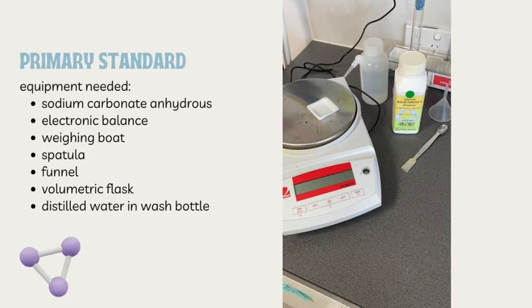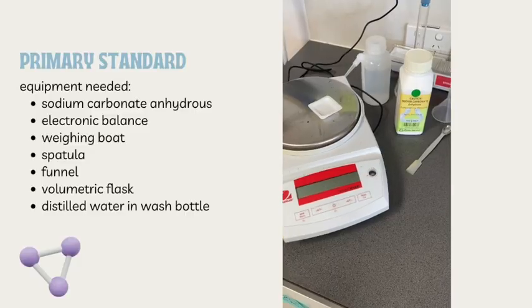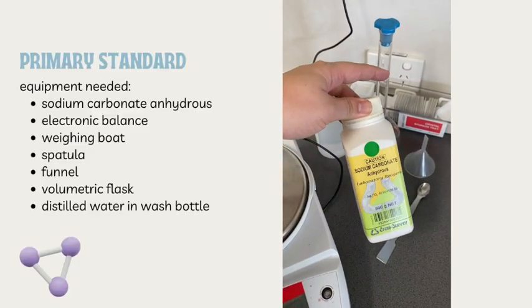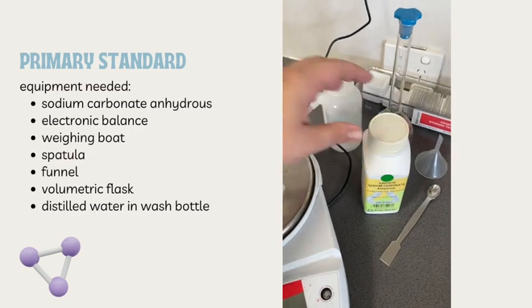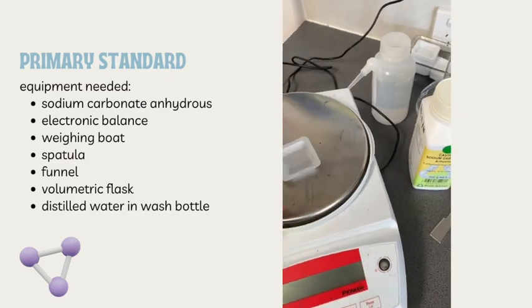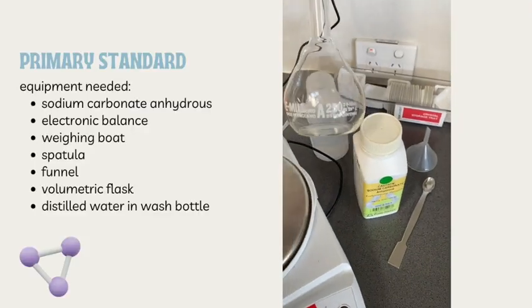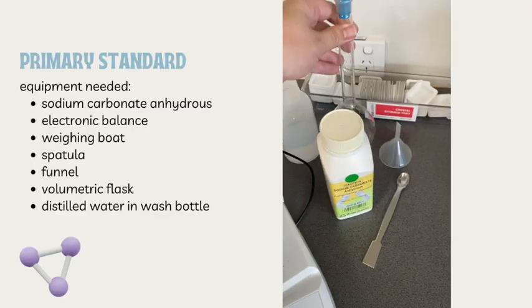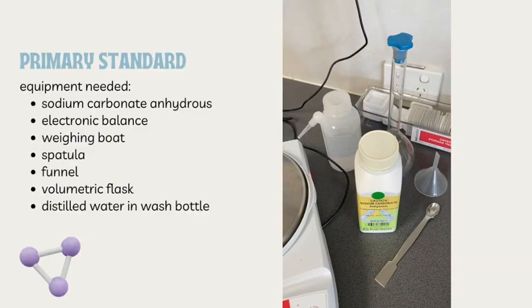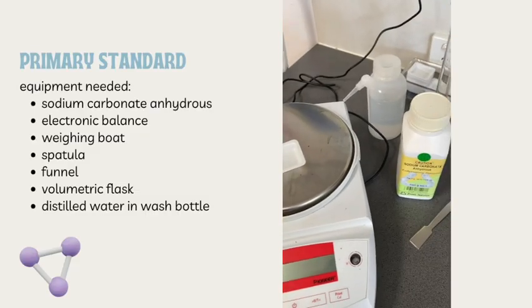All right, so I'm set up now to do our preparation of the standard solution of our primary standard. So I'm going to do a primary standard solution of sodium carbonate. So I've got my sodium carbonate anhydrous, okay, as a solid. I've got my scales and a weighing boat so that I can weigh out the amount that I want. I've got distilled water, my volumetric flask for 250 mL, and I've got a little funnel as well to help me to transfer the sodium carbonate into that flask. So let's get started.